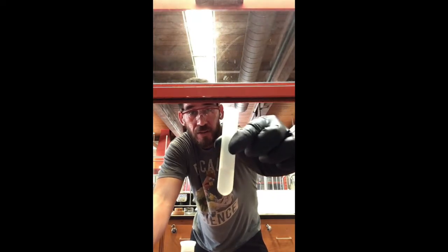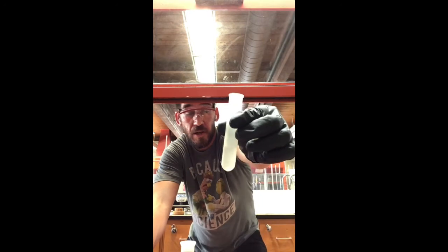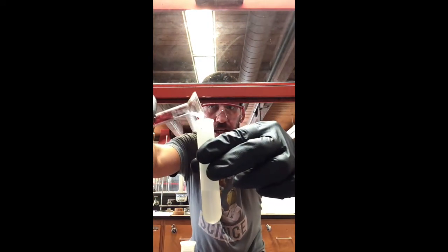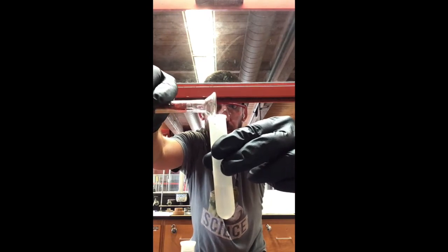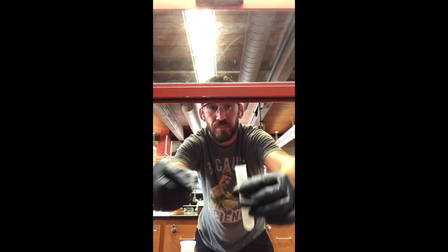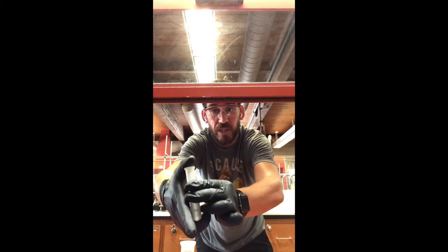So we took the 2 mils of methylene chloride we had in there, and then we placed it in here, right? So now this is just the water that was left behind. I'm going to go ahead and add 2 more mils of methylene chloride to that, because what we're assuming is we didn't get all of the caffeine out on that first extraction. And that's 100% true. We got a lot of it out, but not all of it. And so we want to make sure we get all of it out.